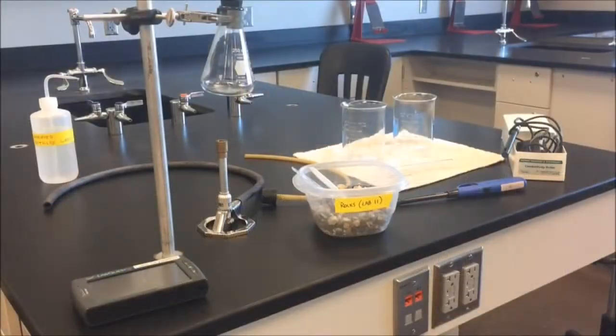The purpose or objective of this lab is to take salt water and run it through the very energy intensive process known as distillation and distill it into fresh water.